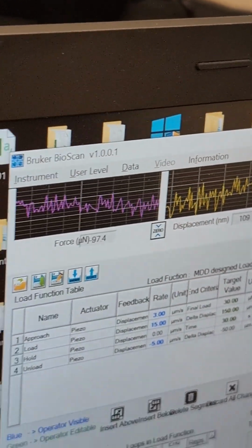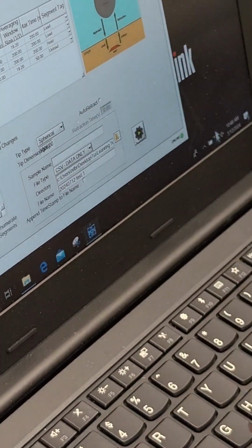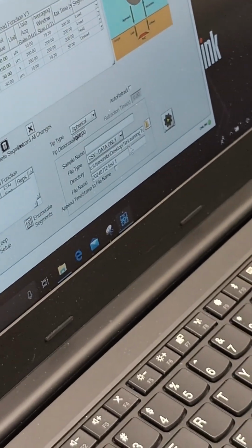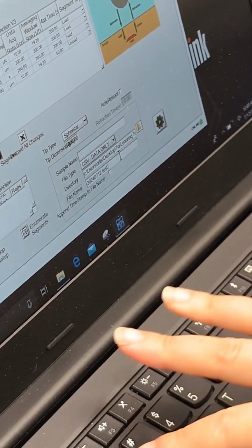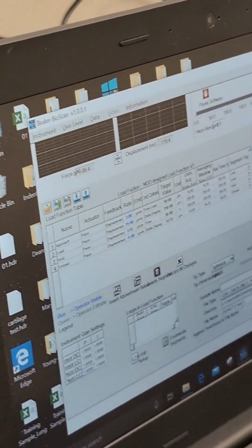Okay. So you can go ahead and hit stop. Then change the name to whatever you want. Otherwise, it will try to rewrite the previous file. It will give you a warning. And yeah, just hit start.